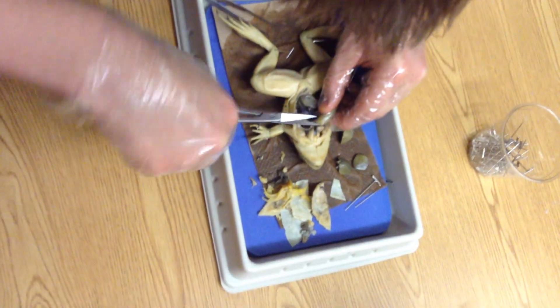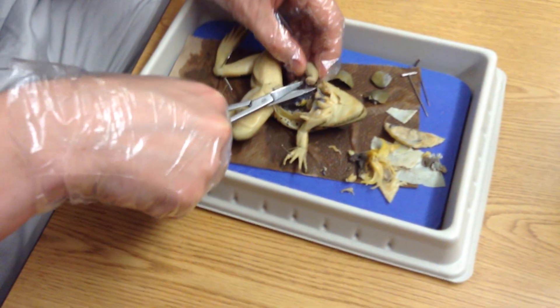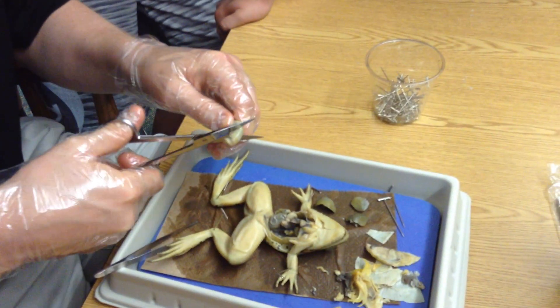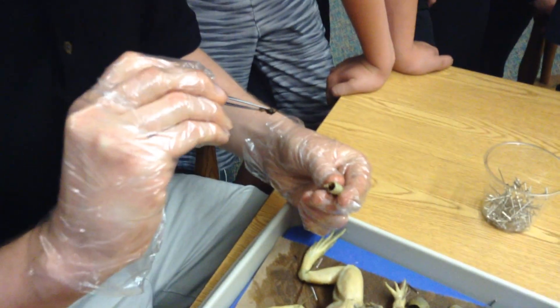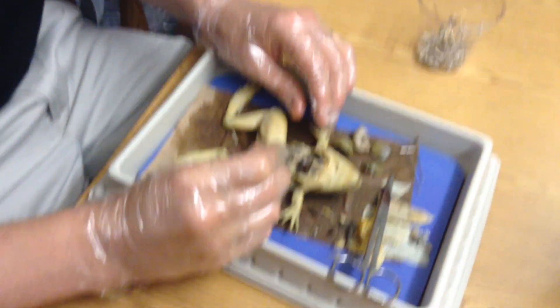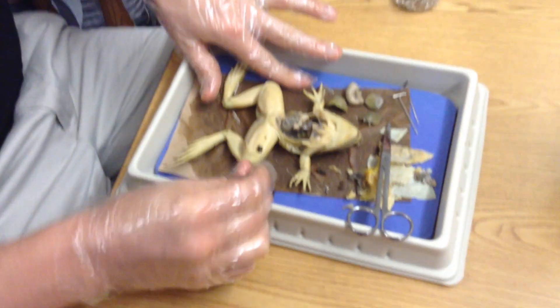But I am curious — we're going to see if I have a gift here. You can see other parts in there; there's the spleen right in there as well. Now I'm going to open up the stomach. If there's something inside, I might cut it in half — please don't squirt. There's something in there. What do we got? I don't really know what it was yet. Oh, it might be a beetle — it kind of looks like it was a beetle. It looks like some legs. Probably a beetle. That's so cool!